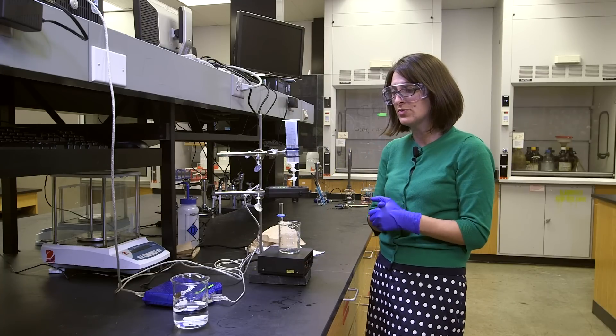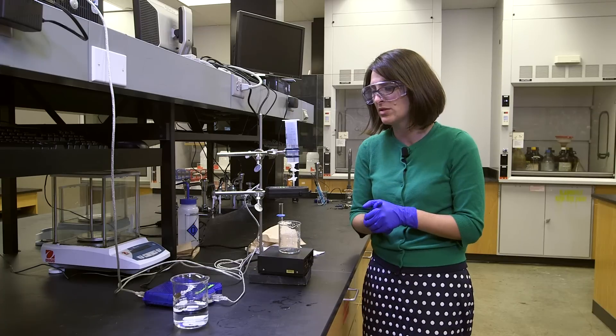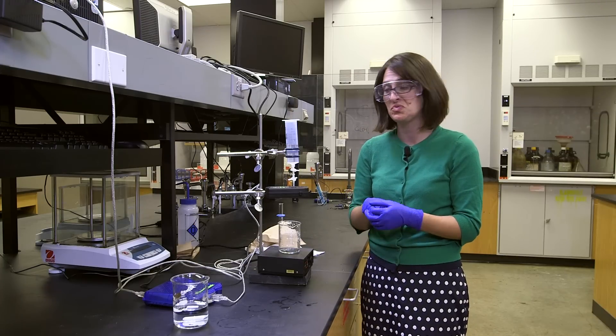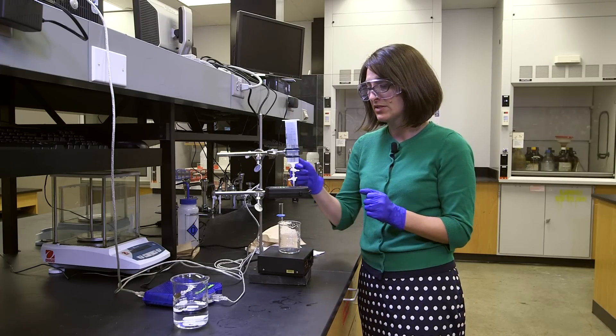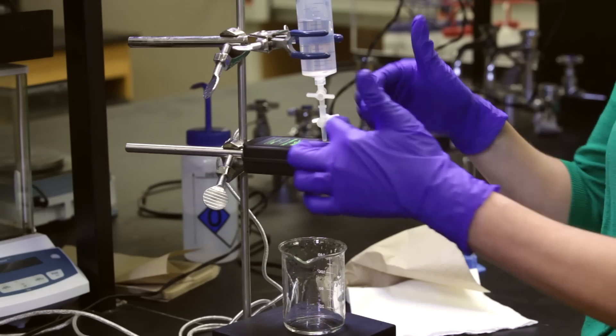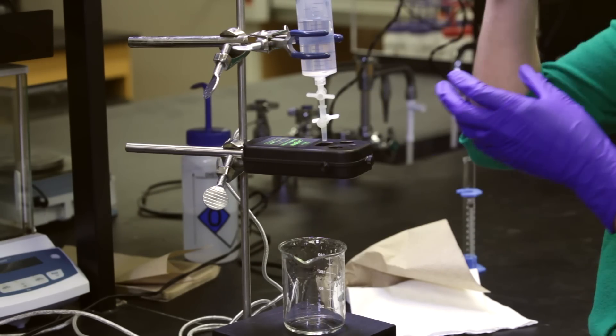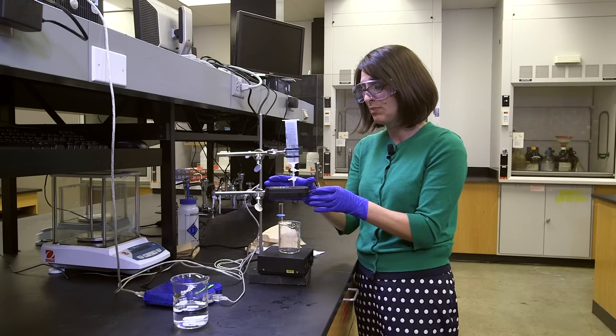Okay, so the drop counter is really useful because it's going to basically measure the volume for us, which is really convenient. And there's a little IR sensor in the path, sort of rectangular path cutaway in the middle of this black brick.